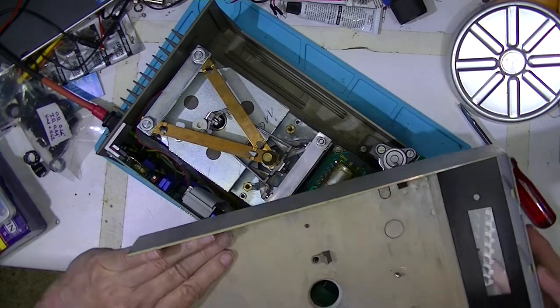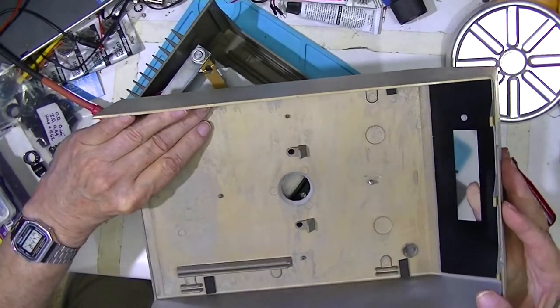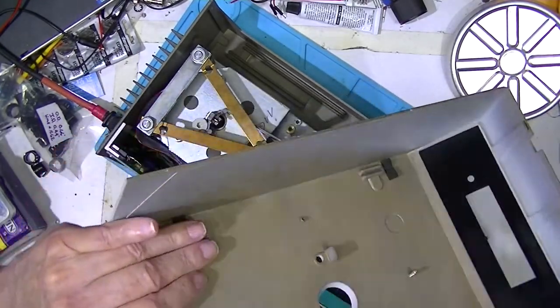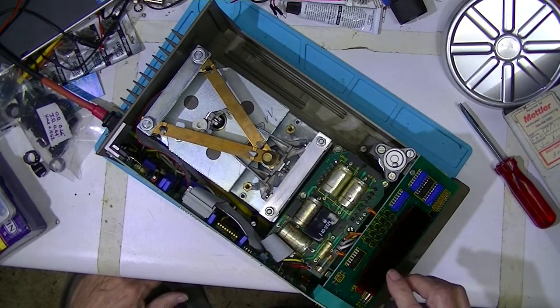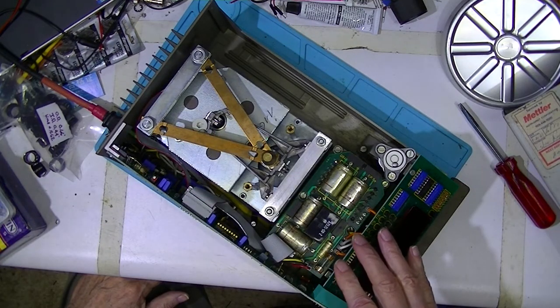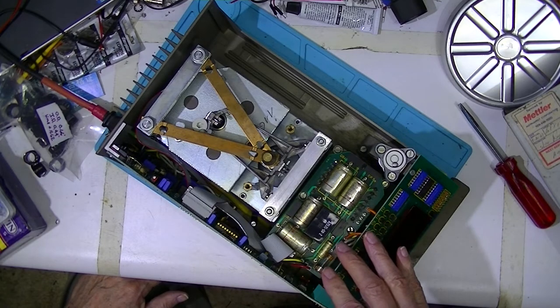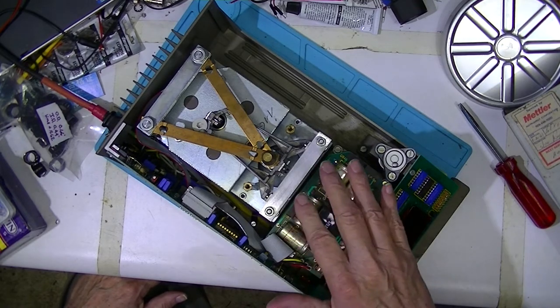And there we go. The cover is a die cast aluminum cover. The frame is cast aluminum with some fasteners on it.